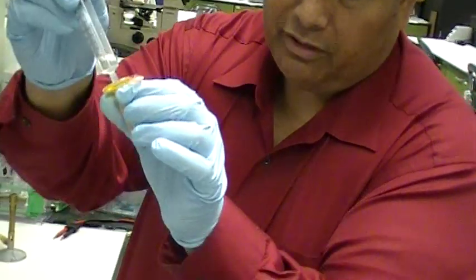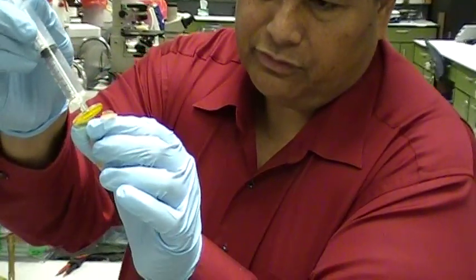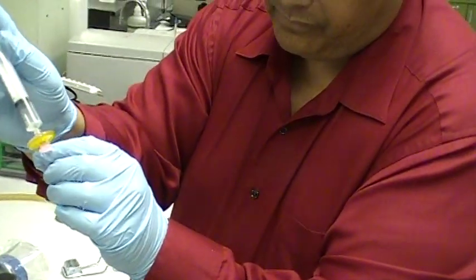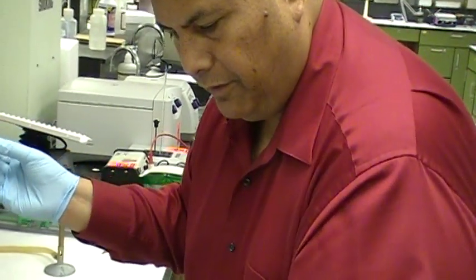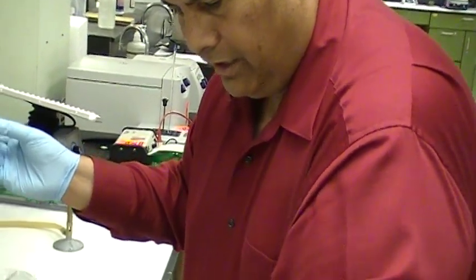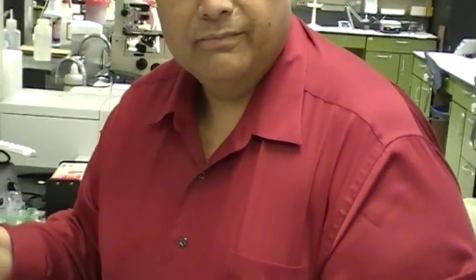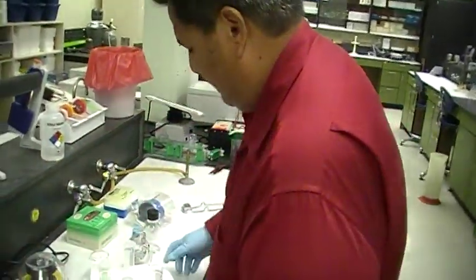And you just continue until all the tubes are full, like that, and the entire solution that you filter is out, like that. Let me repeat this, like so. And so here you have filtered and sterilized solutions that are in different aliquots. Okay? And you just get rid of this in a biohazard bag.